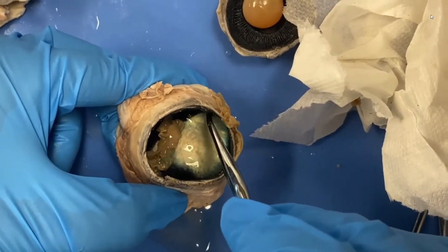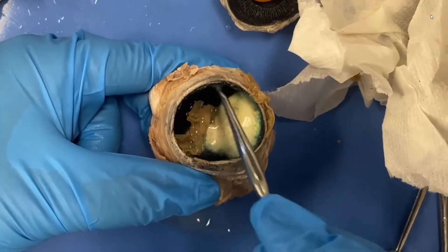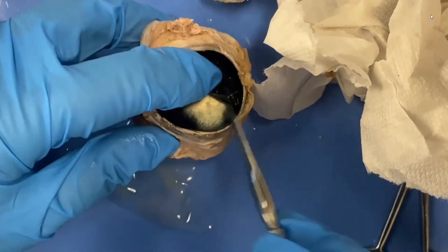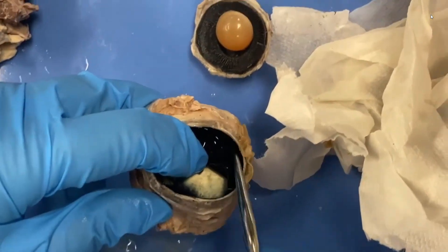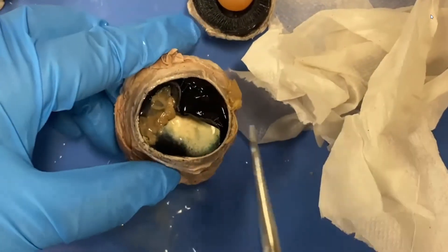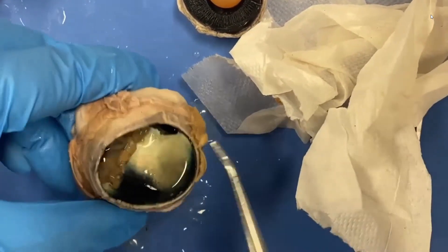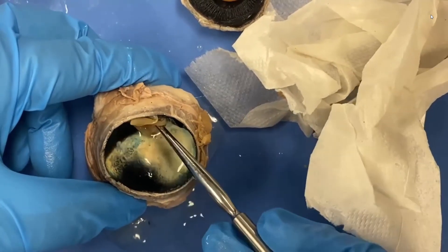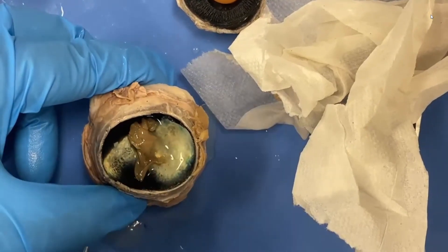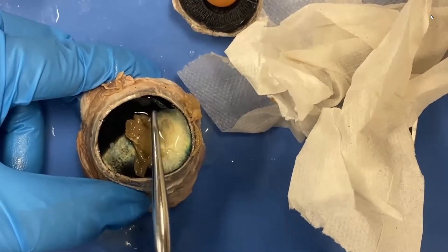Unfortunately, we don't have that layer, so we don't see very well in the dark. The black layer is the choroid — C-H-O-R-O-I-D — and the choroid is a vascular layer. If we take that layer off, we're going to get back to the sclera. There's that tough sclera layer, which in us would be white in color. You can see it's very tough — I can hold the whole eye up with it. So to go over this again: the fluid we took out was the vitreous humor; the beige layer, the most inner layer, was the retina; those fibers exit at the optic disc; this colored layer is the tapetum lucidum; the black layer is the choroid; and last, the white layer is the sclera.